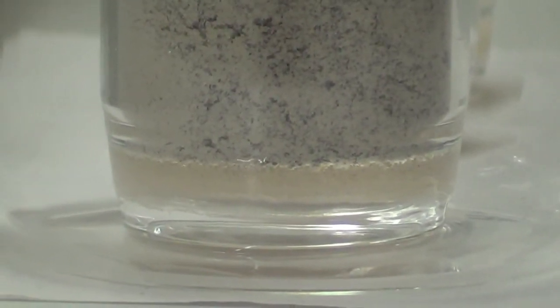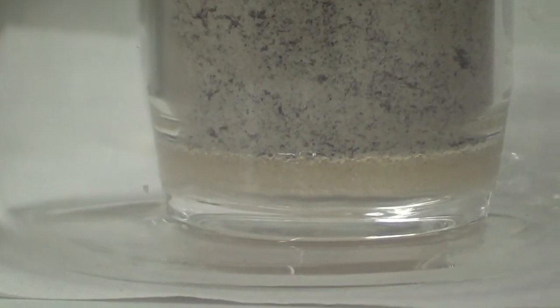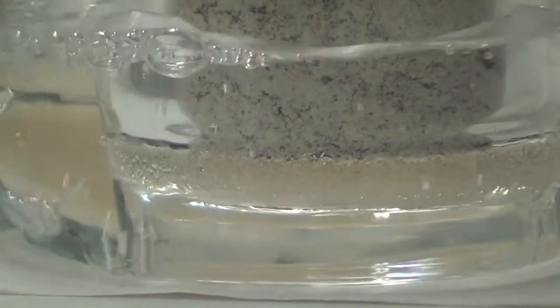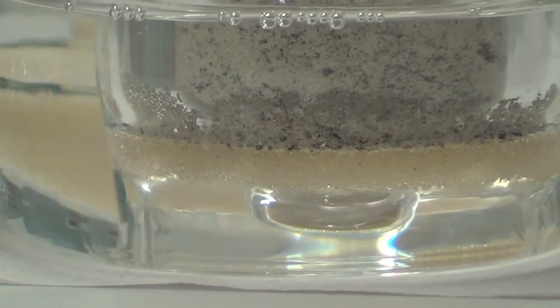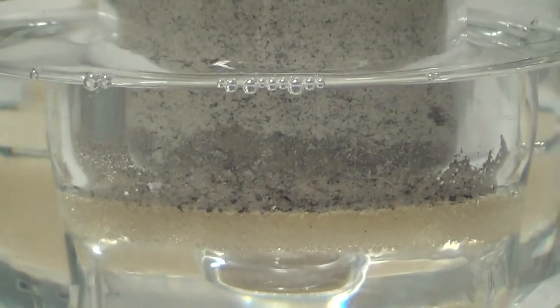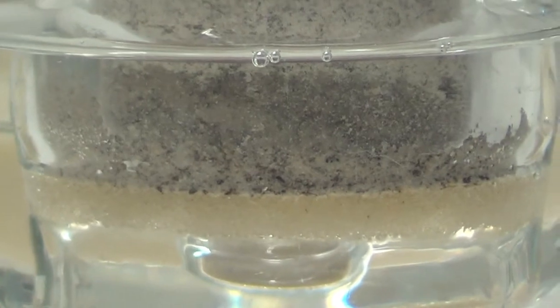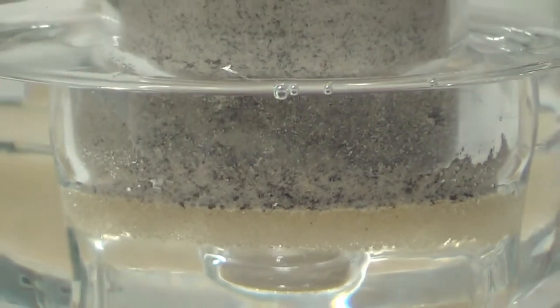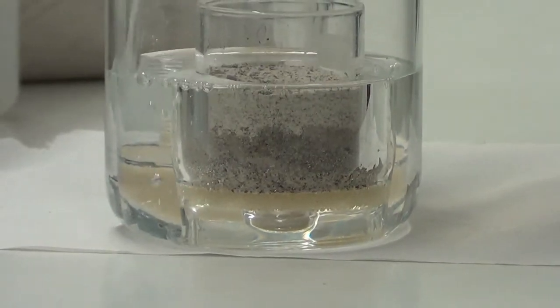So we should fill the container from outside with water, because the idea is to allow the water to enter the soil from the bottom to the top. We should fill the water to a level not higher than the top of the cylinder, in order to force the water to enter from the bottom.